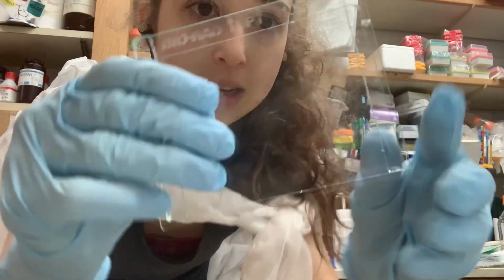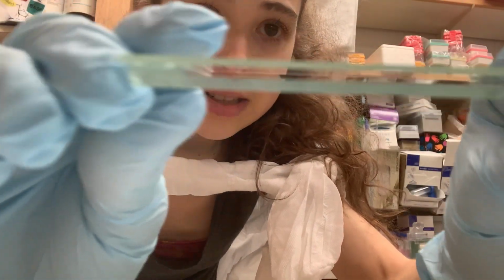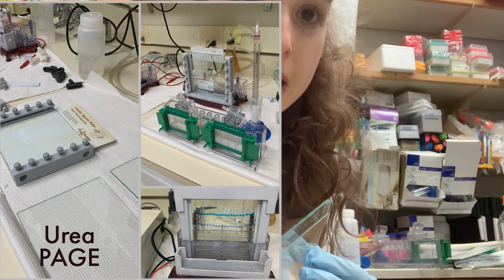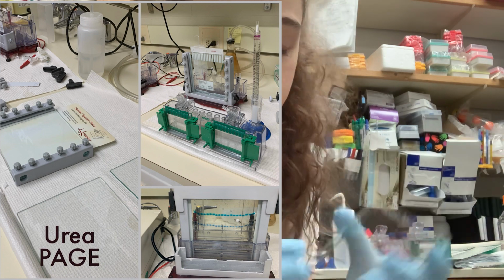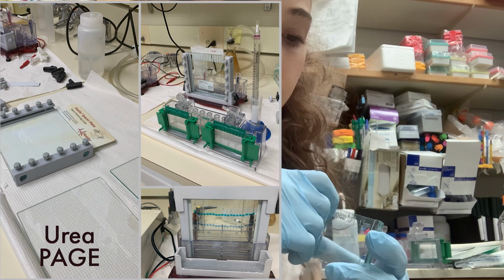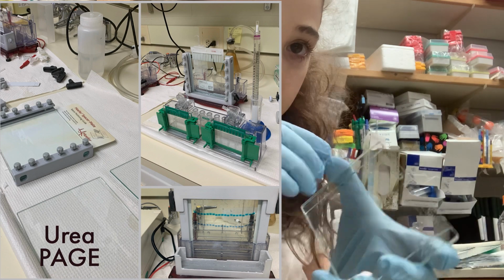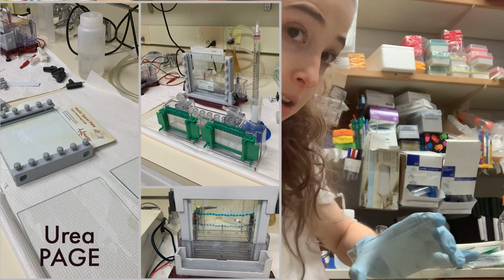And so when you add the glass on top, you get that hole, and that's where the gel is going to be. So if you have a 0.75, it's going to be thinner. For other types of gel, like when we do urea page, the bigger ones and stuff, you actually have to put your own spacers in. You just have 2 plates, and then you can put different width spacers, and then clamp them together or tape them together depending on the gel and the system.